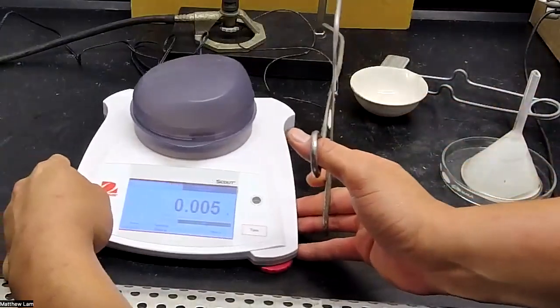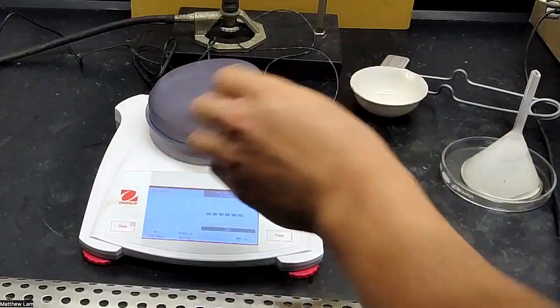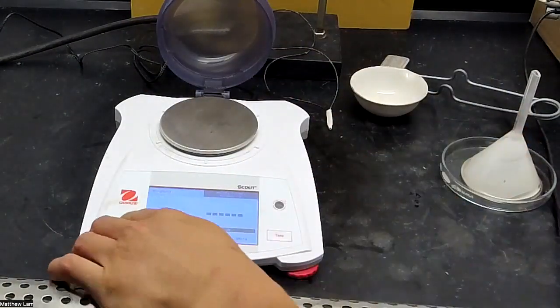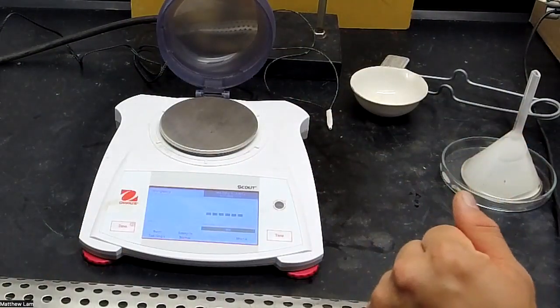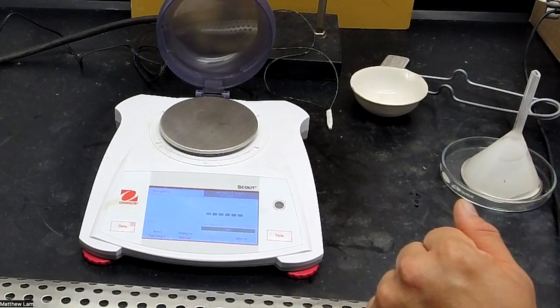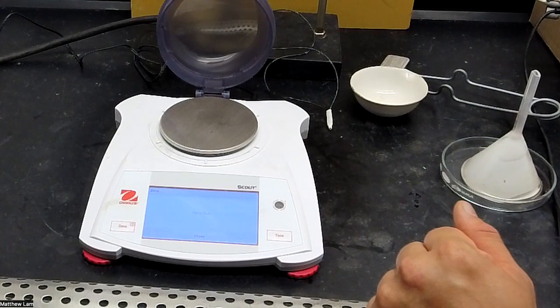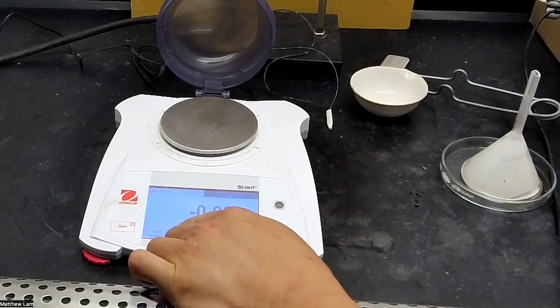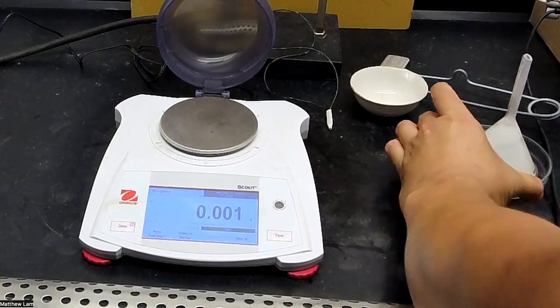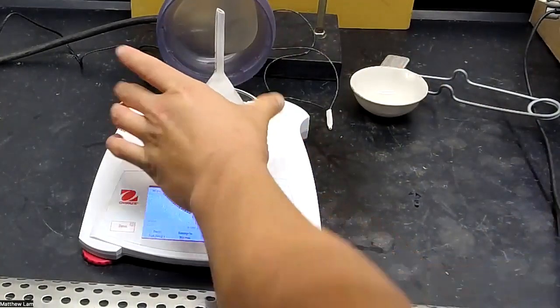And we'll weigh it. So we'll weigh out. Sorry, I zeroed it out. And so once that is at zero, I'm out again. Okay, we're going to presume that's at zero. So we're going to put this and we're going to weigh it out.